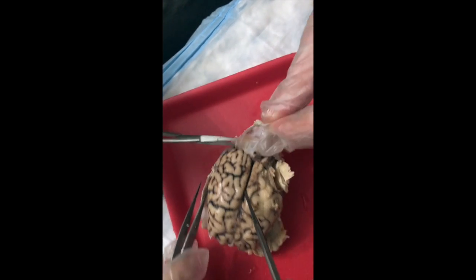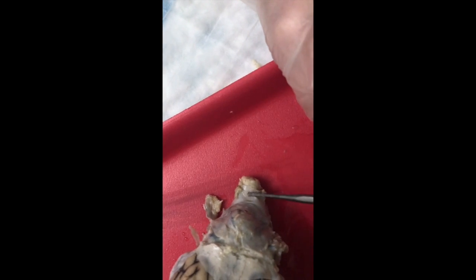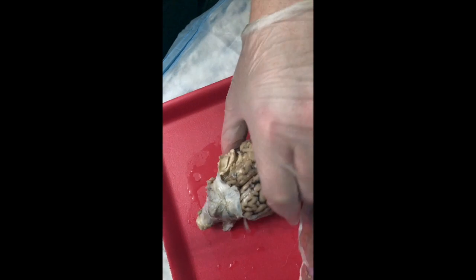Okay. So now you're seeing the cerebral hemispheres become exposed along with the longitudinal fissure, and we're reaching the transverse fissure between the cerebrum and the cerebellum. So now the ligaments are very hard right here, so we're going to have to come up from the brainstem region and cut through the meninges from the coverings over the brainstem, because the meninges do continue down and cover over the length of the spinal cord. And we're going to make that incision up towards the cerebrum.